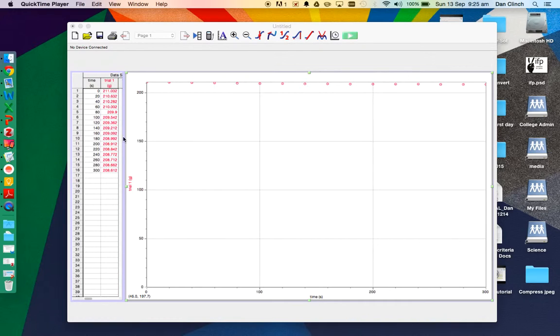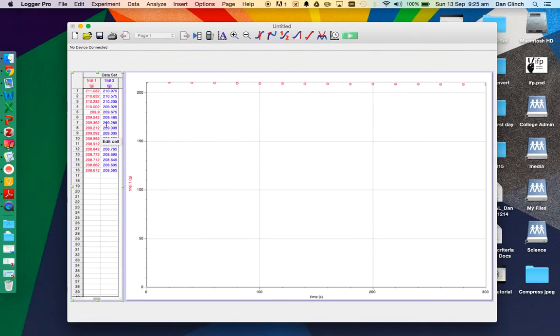Because we've got one set of our three sets of data graphed, just the red first trial, and it's all squashed up at the top, which can't be interpreted. So the first thing we want to do is get all three sets of data on there.